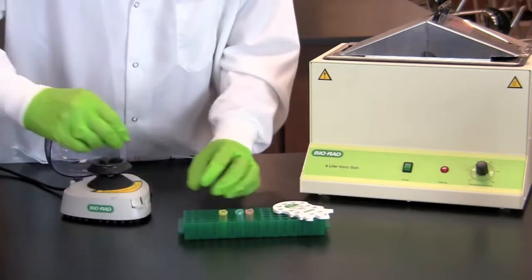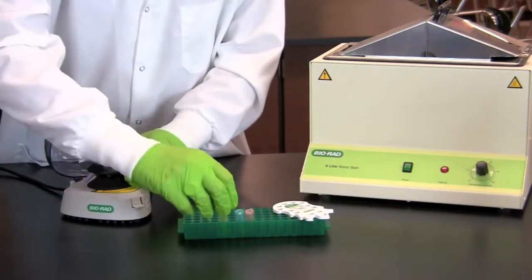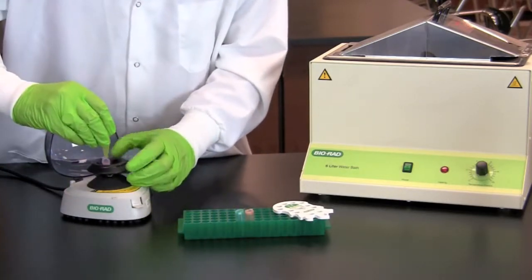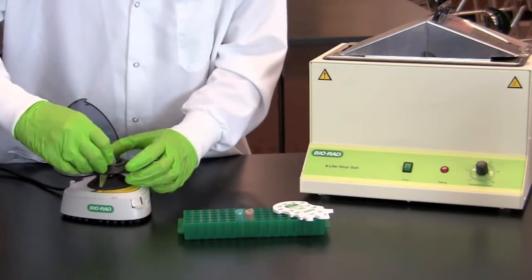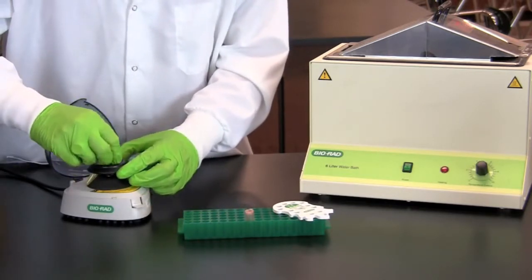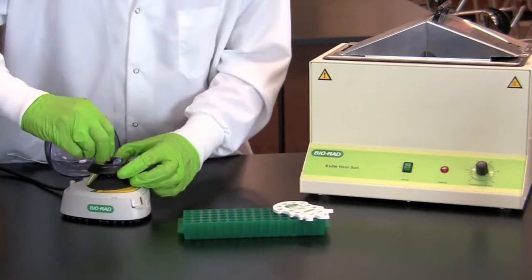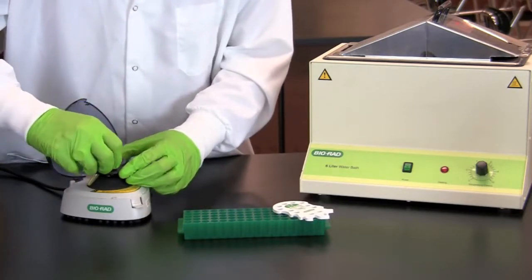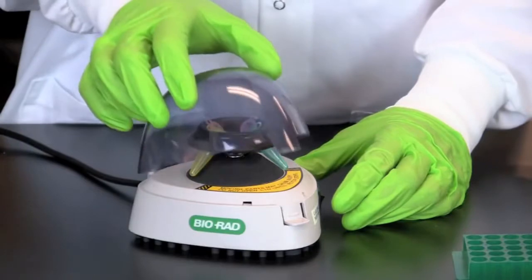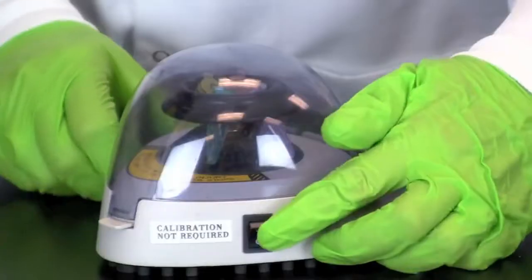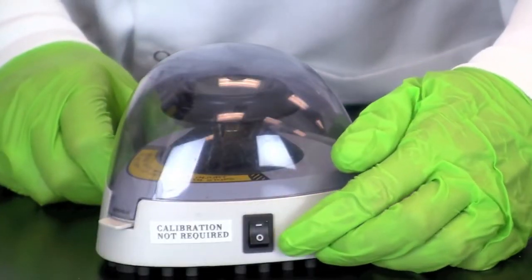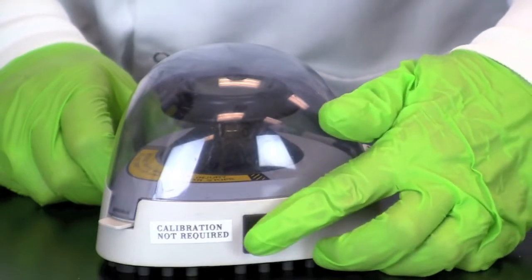Then place the samples in a microcentrifuge, making certain the load is properly balanced. Spin the samples for a few seconds to collect the samples at the bottom of each tube.